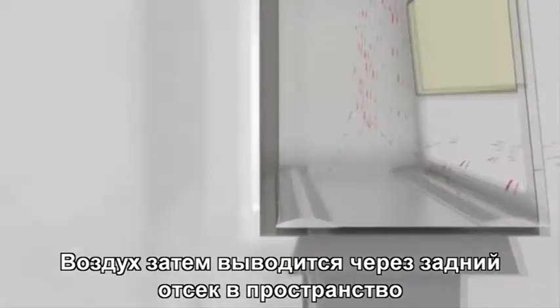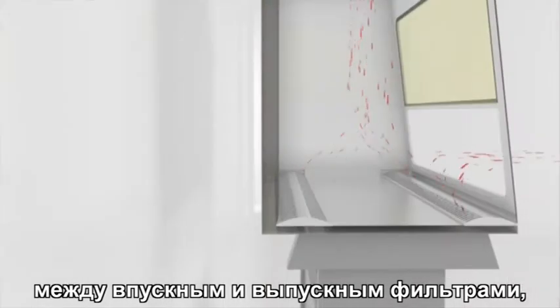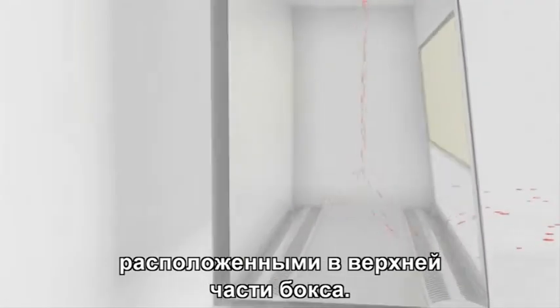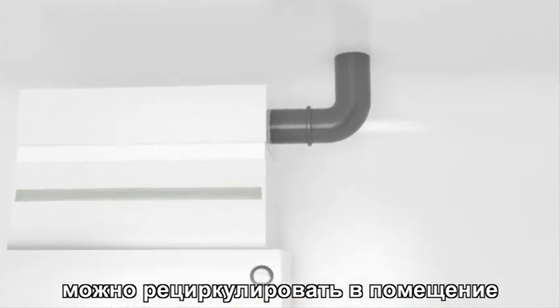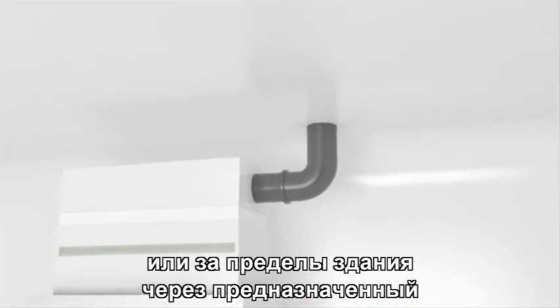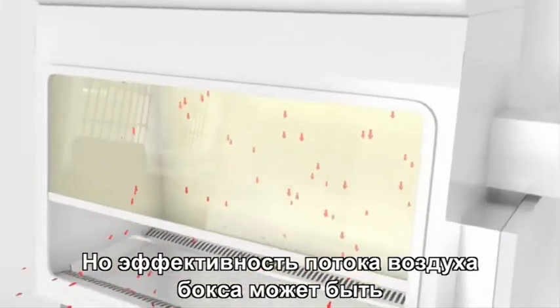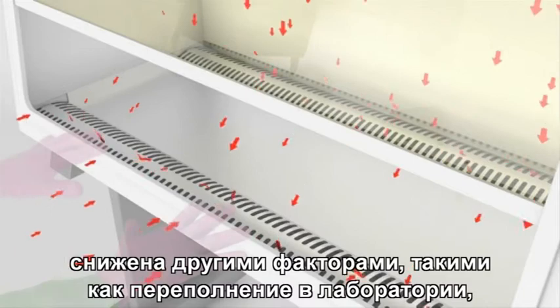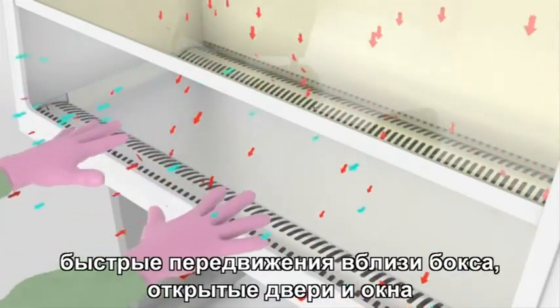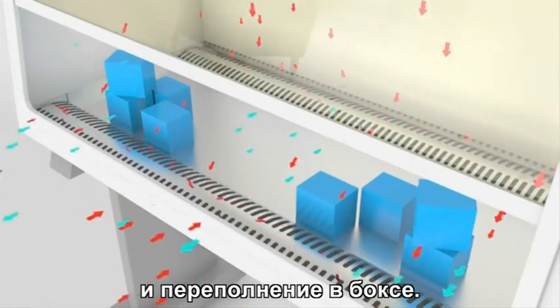The air is then discharged through the rear plenum into the space between the supply and exhaust filters located at the top of the cabinet. HEPA filtered air from the exhaust can be recirculated to the room or discharged to the outside of the building through a dedicated duct or through the building exhaust system. But the efficiency of the cabinet airflow can be compromised by other factors such as overcrowding in the lab, rapid movement around the cabinet, open doors and windows, and overcrowding in the cabinet.